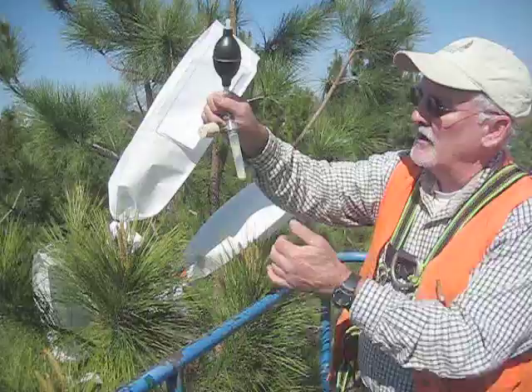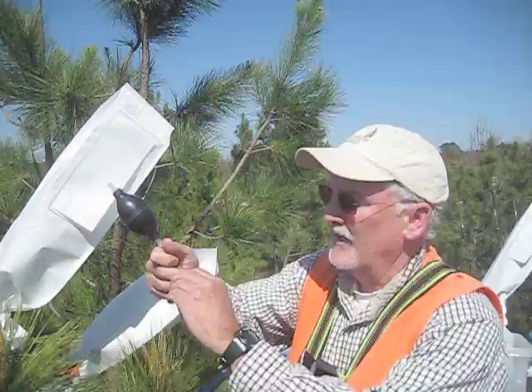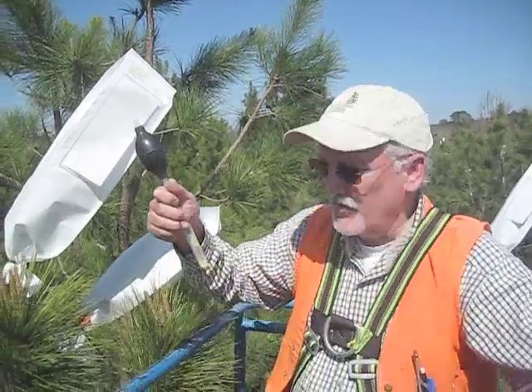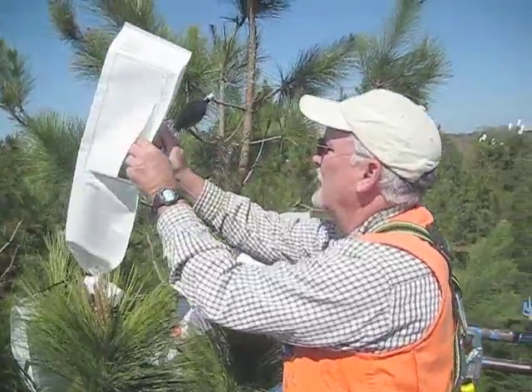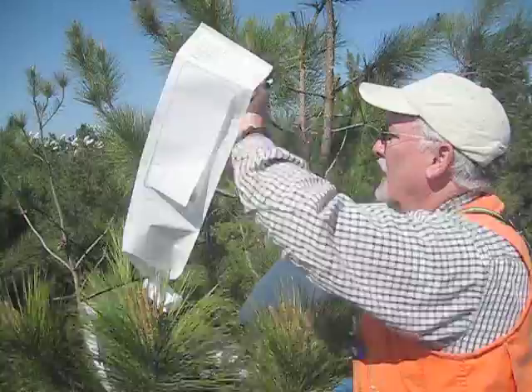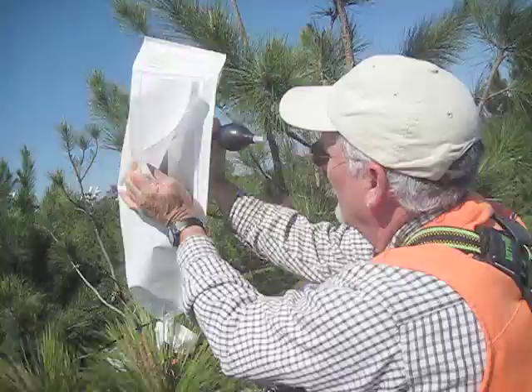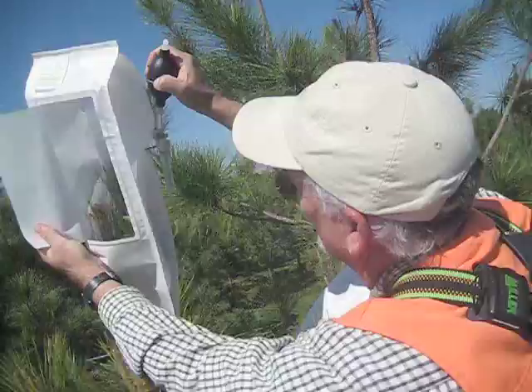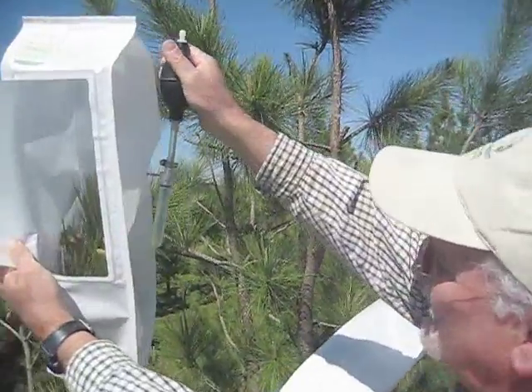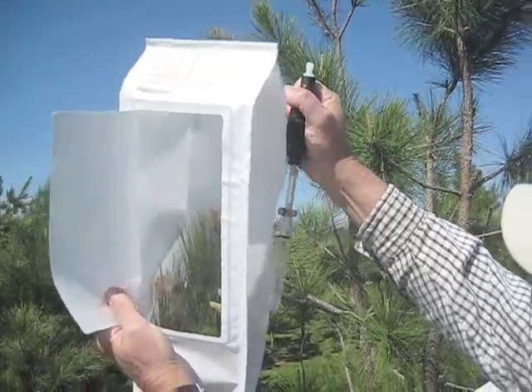You can see the pollen — I put about a cc of pollen in there. I'll take off the cork and set it over here. We keep that there just for protection because these needles are sharp. I'm actually holding the bag securely and poking that needle into the pollination bag. I'm holding the pollen down and start squeezing the bulb, and you can see what happens.